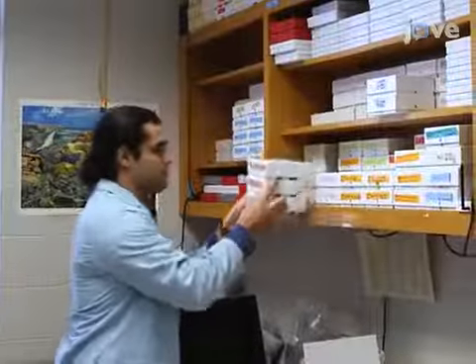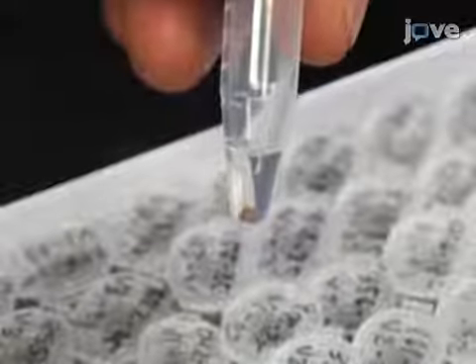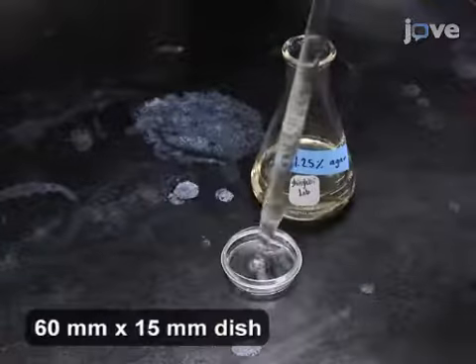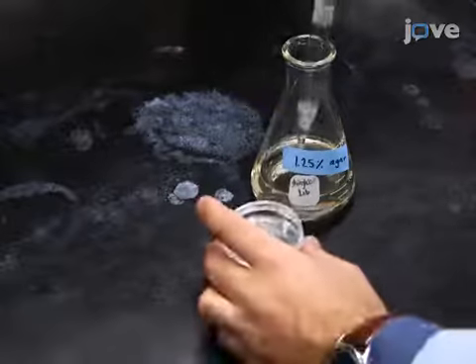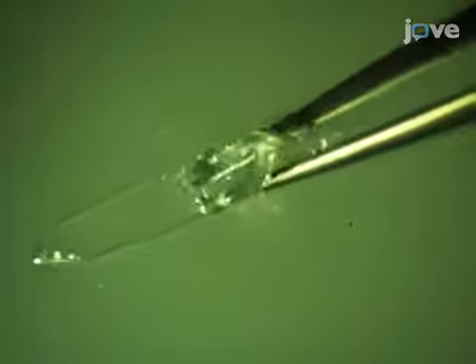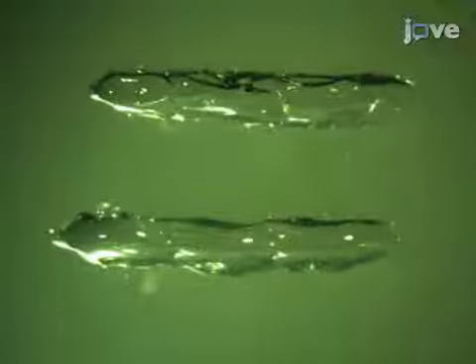Prior to imaging, the flies can be stored in 70% ethanol to maintain their pigmentation. Visualization requires a mounting pad. Load a 60 mm Petri dish with about 10 ml of 1.25% agar in water. Under a microscope, use fine forceps to dig a 20 mm long, 2 mm wide, 1 mm deep trench into the gel. Several trenches can be made in one dish.